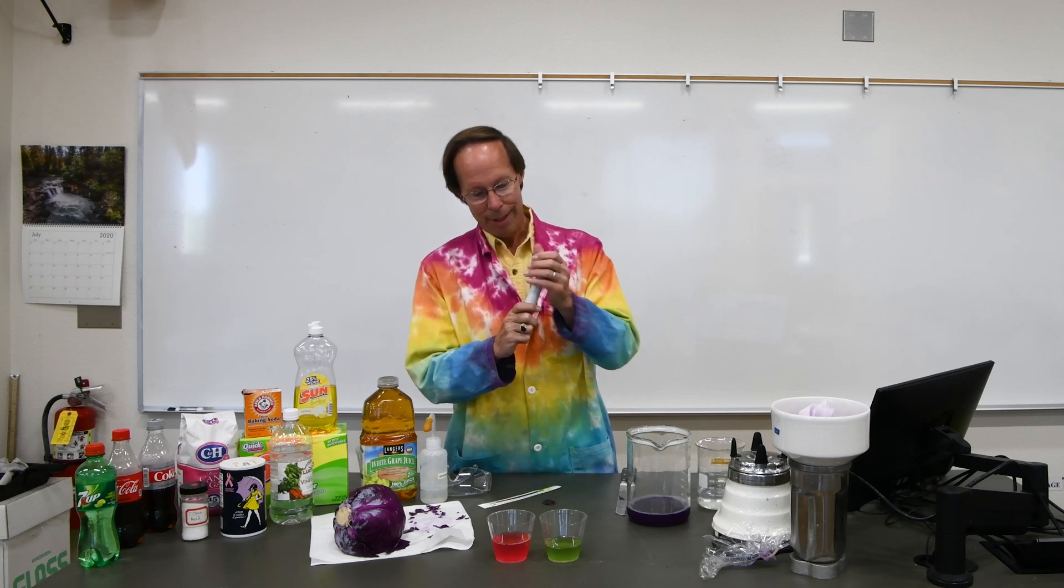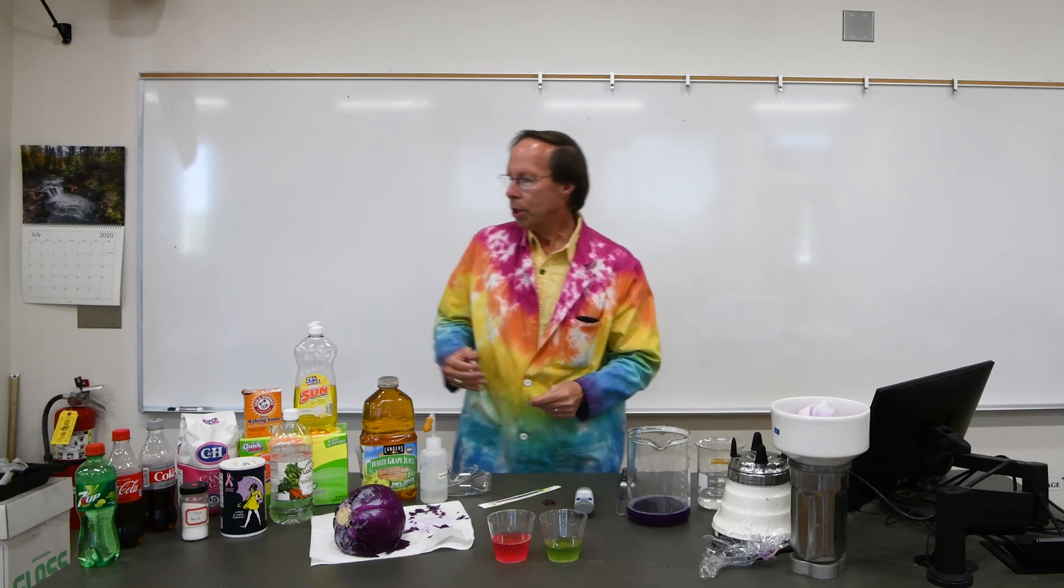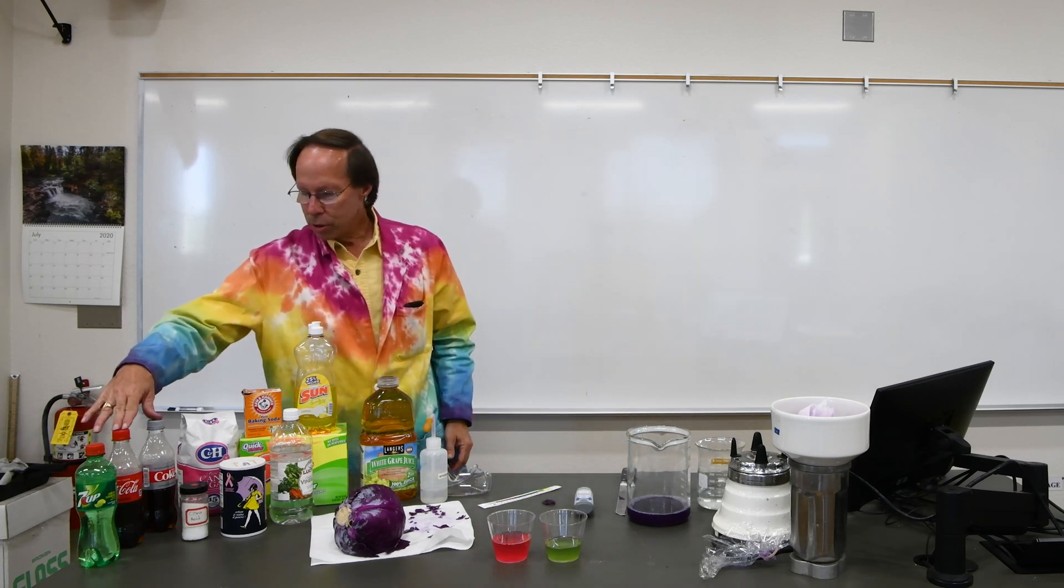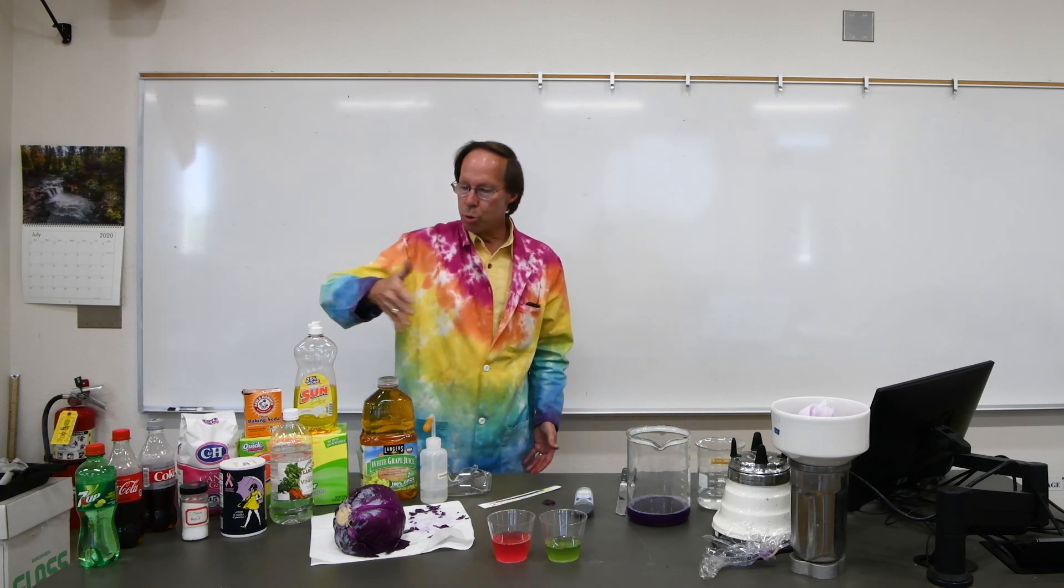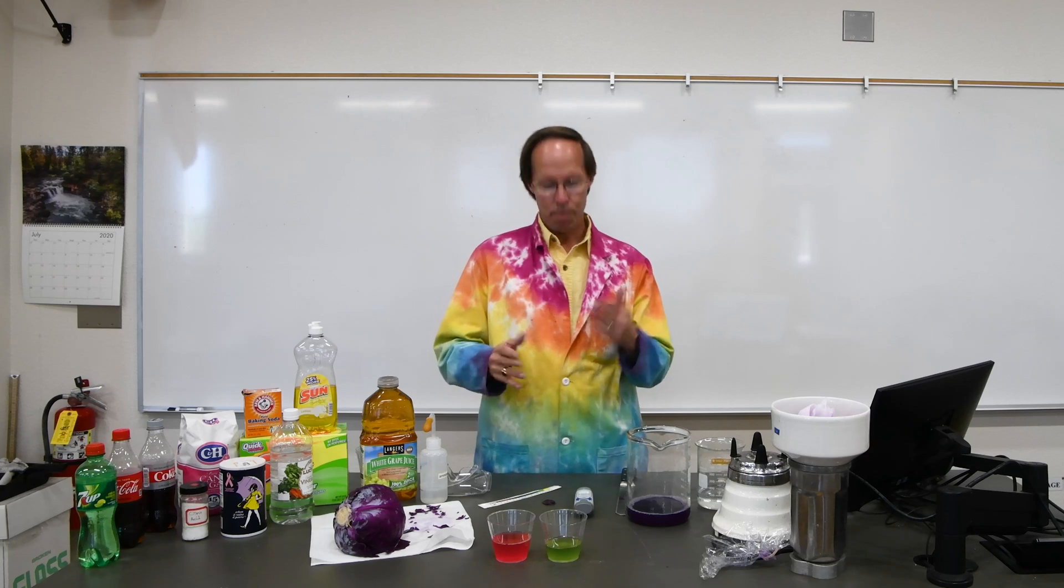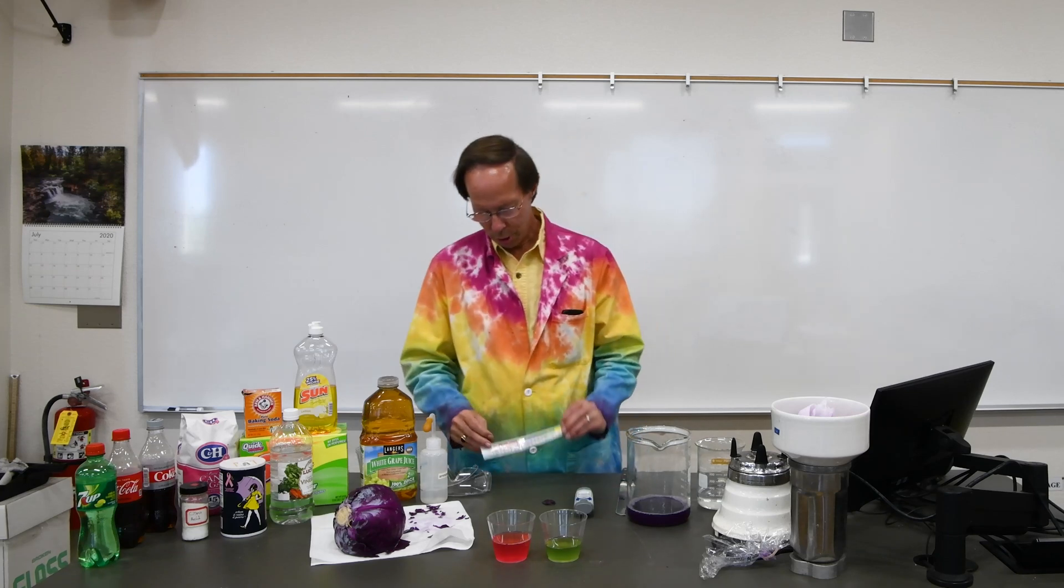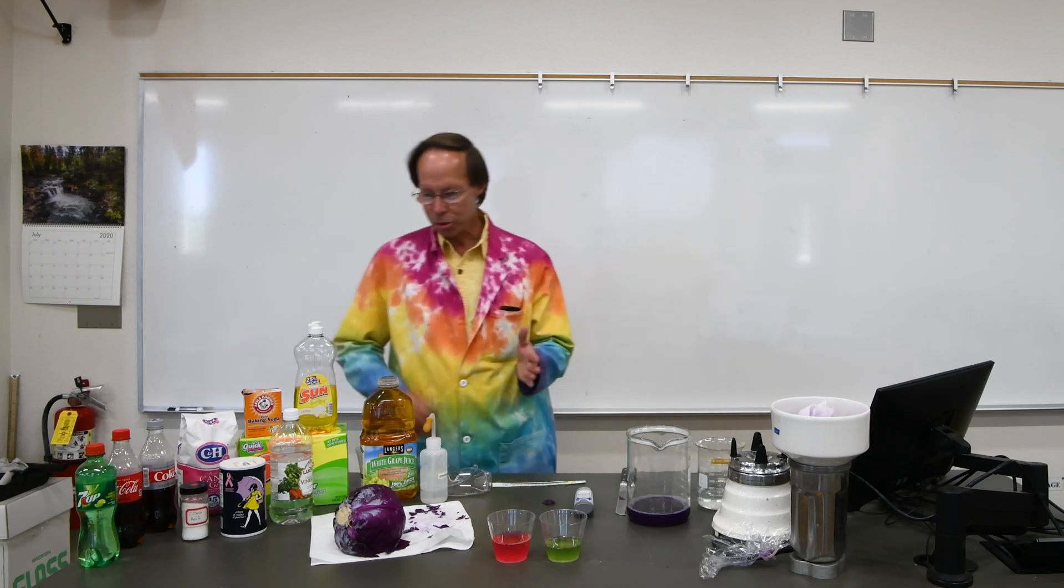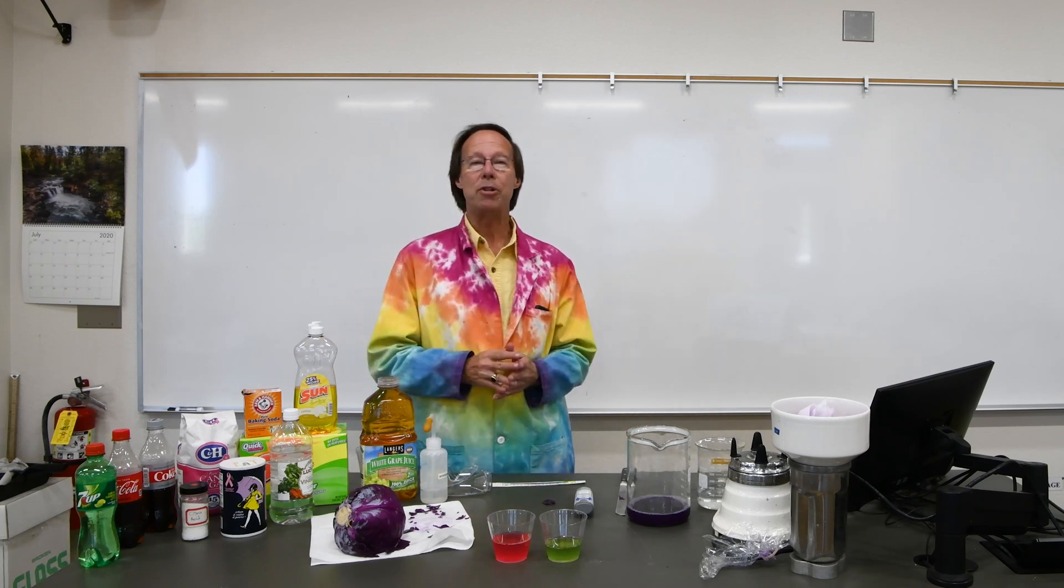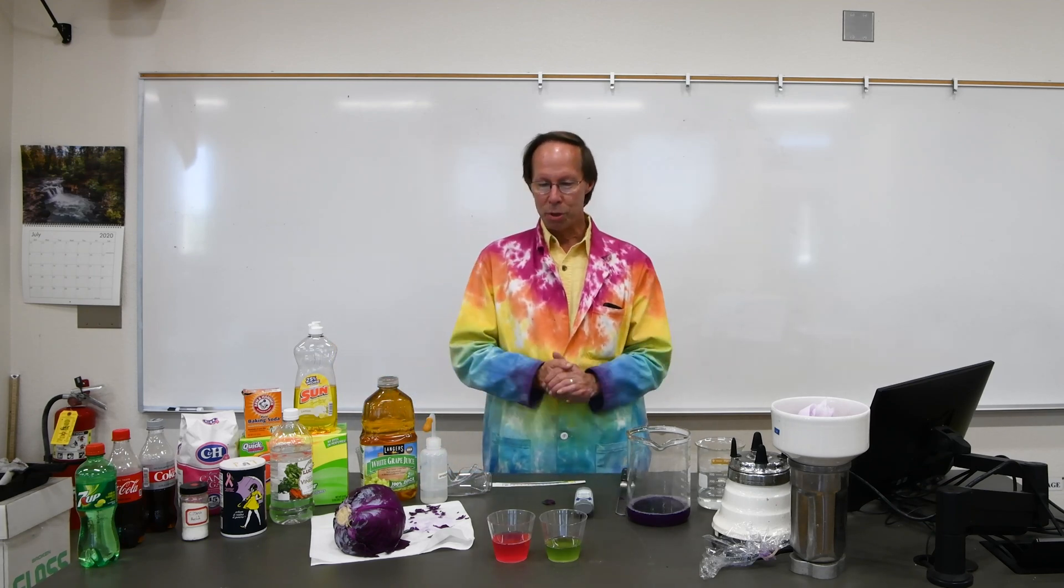So it's very simple. This, of course, is not something one can easily do at home. So we're going to be testing Coke and Diet Coke and then you can choose any three of these other samples you'd like. And those three will give us an idea of how the pH meter compares to the cabbage juice. So we'll see if your cabbage juice estimates come out close to what the pH meter tells us it actually should be. So let's head on over into the lab and we'll get to work.